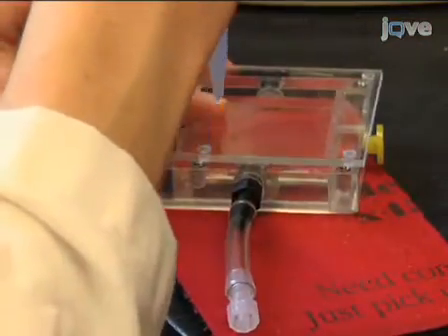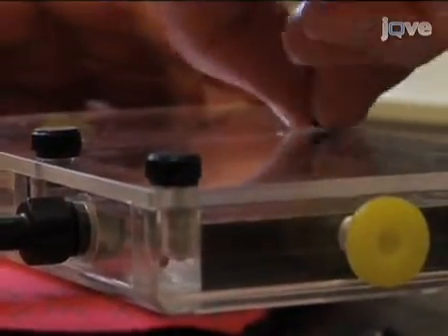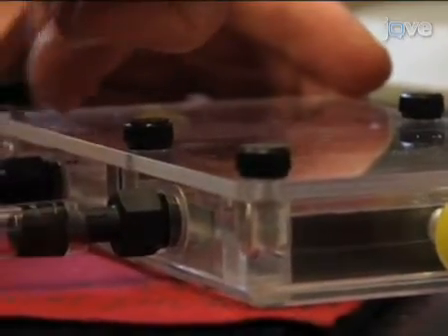When flies are inside, remove the funnel and reposition the plexiglass top over the screw beds. Then rescrew the plexiglass top into place.